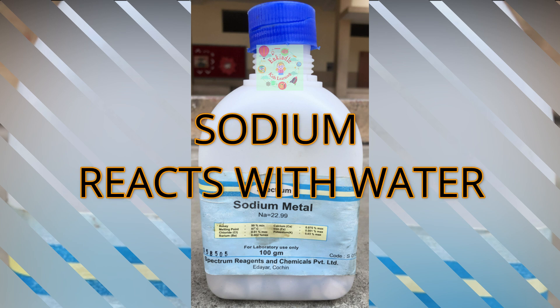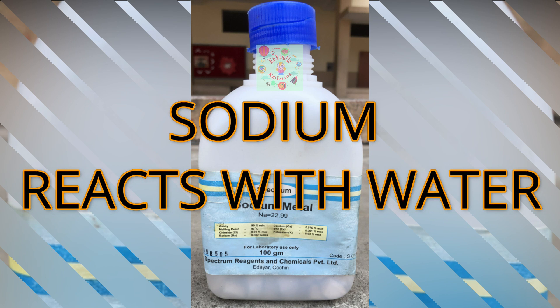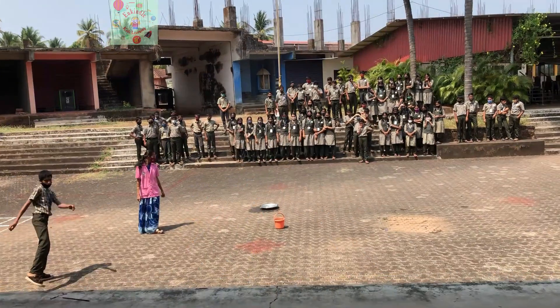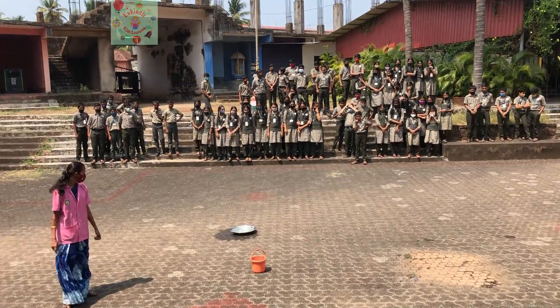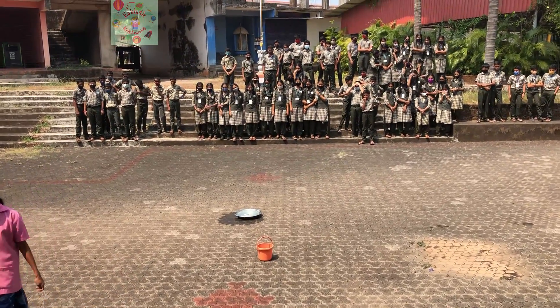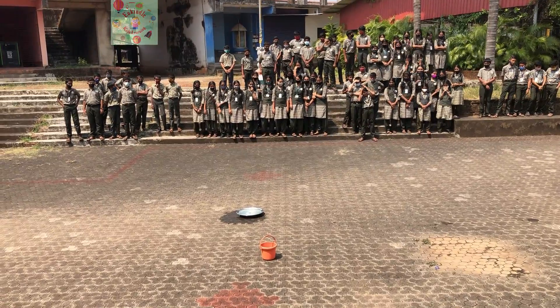Hello everybody, today we will see how sodium reacts with water. Sodium is an alkali metal. The symbol of sodium is Na and its atomic number is 11.